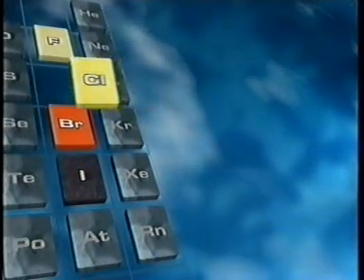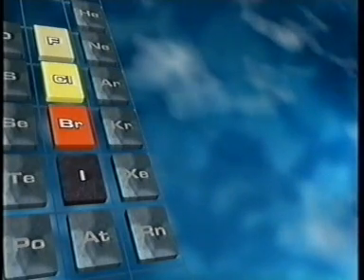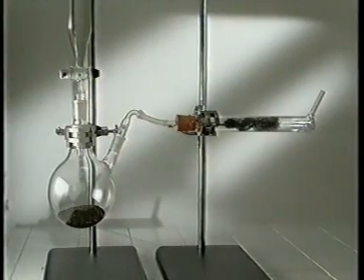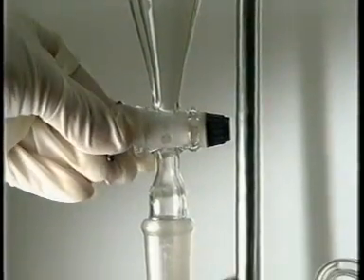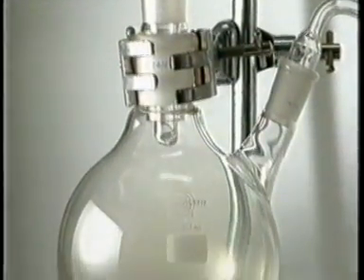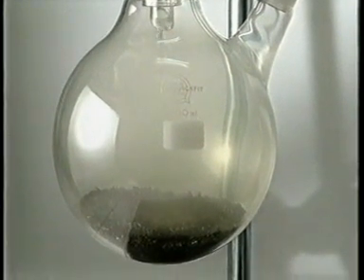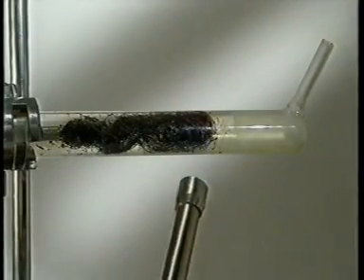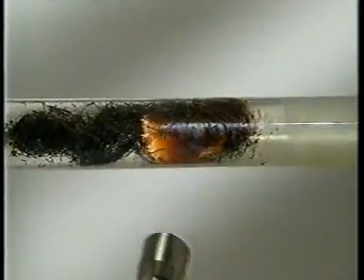Chlorine is above bromine. So how reactive will chlorine be? The apparatus on the left generates a stream of chlorine gas. Concentrated hydrochloric acid is slowly dripped onto potassium permanganate. This time the iron wool needs the slightest lick of a flame before a violent reaction races along. Clouds of pale yellow iron chloride quickly form.